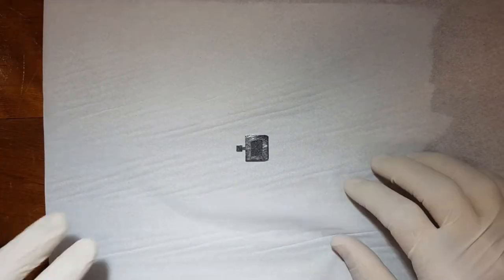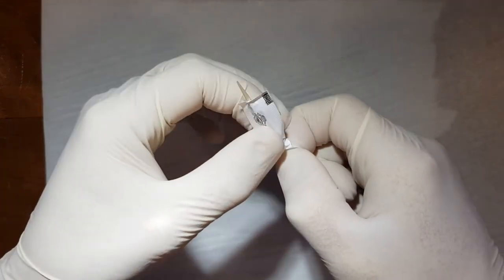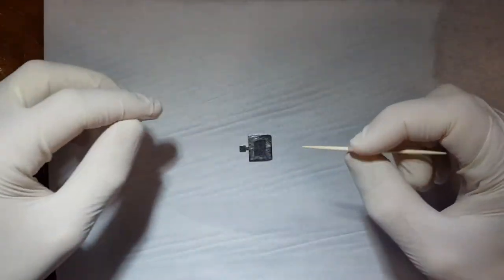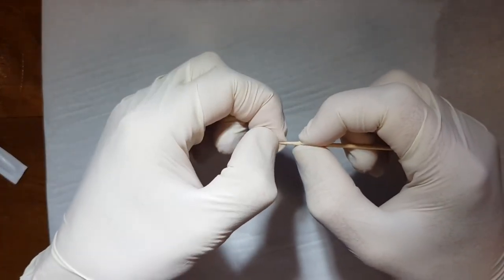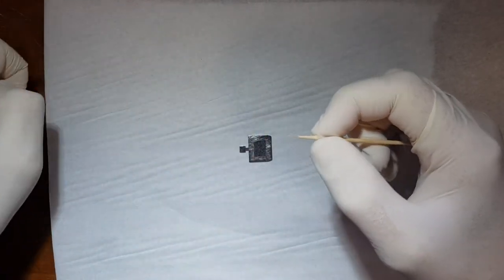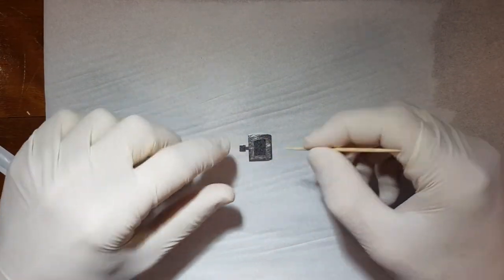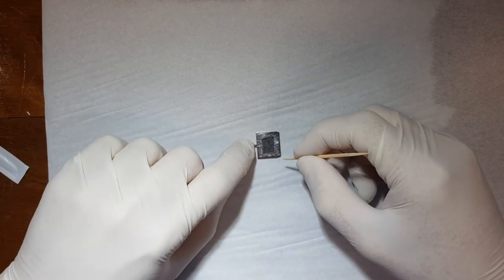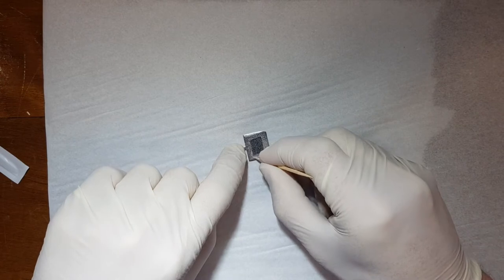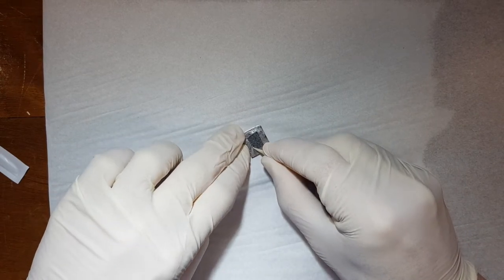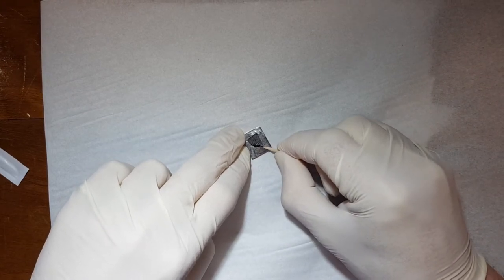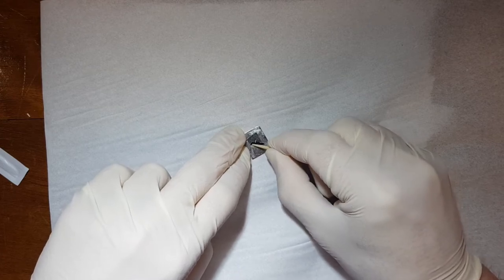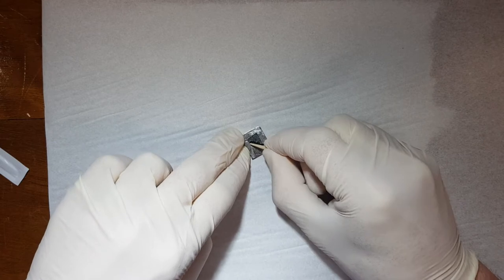So what I like to do is use that toothpick. Now of course this toothpick you can use to clean until the toothpick breaks, because eventually it will break. Now what I like to do is I like to snap off the point to make the toothpick a little blunt, and then I apply pressure on the tab like so, and I start on the side and I lift up the carbon tape very gently. The reason I'm doing it gently so that the carbon tape doesn't rip. The moment it rips it's obviously not a train smash, it just makes it a little bit more difficult to remove.